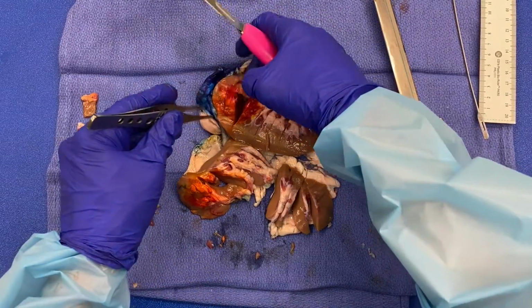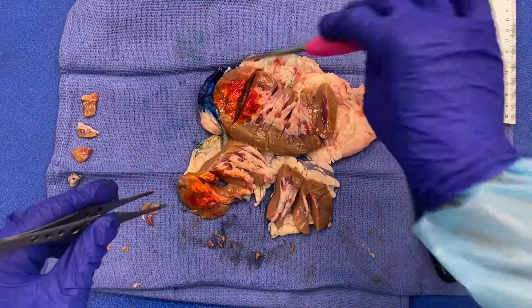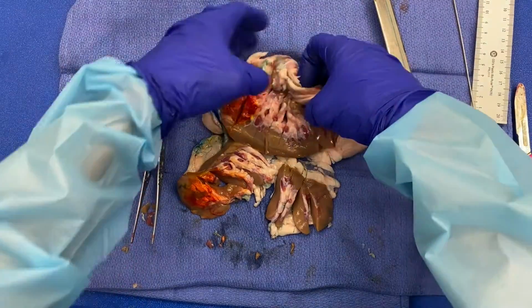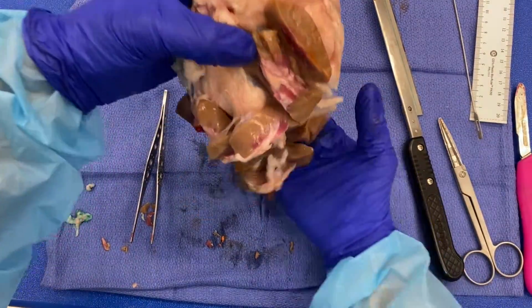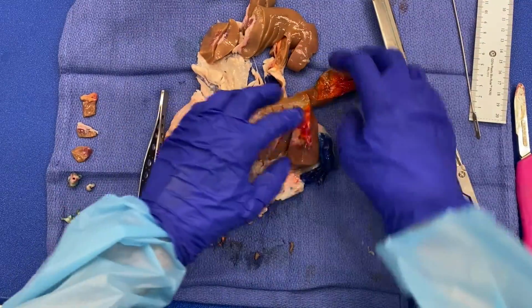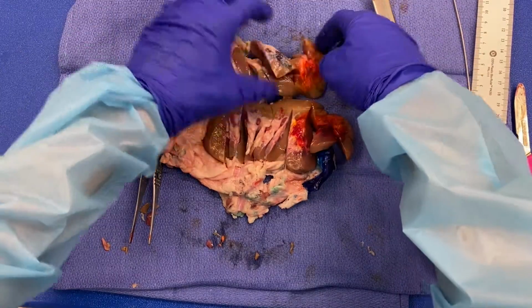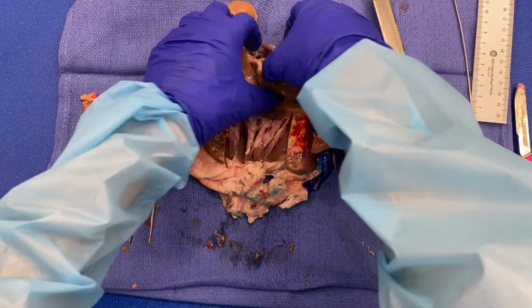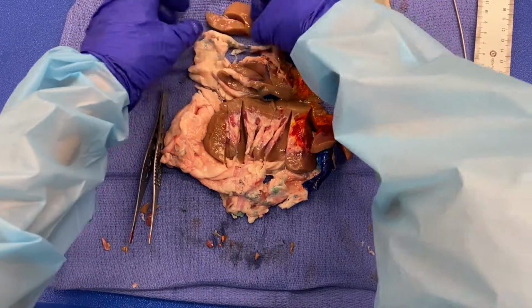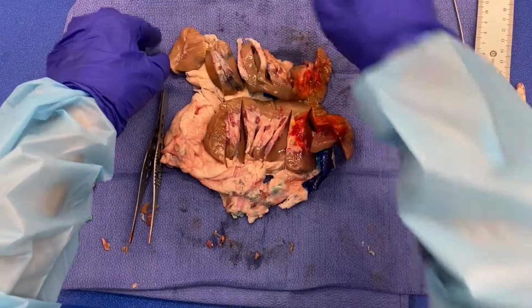So now what I'm gonna do is get my tumor to Gerota's fascia. So let's say it was closest over on this side. So you have to use ergonomics, right, and move the specimen so that you can cut the best. Okay, so as you can see, I've kind of left it a little bookend so that I can maintain some orientation. Okay, all right.